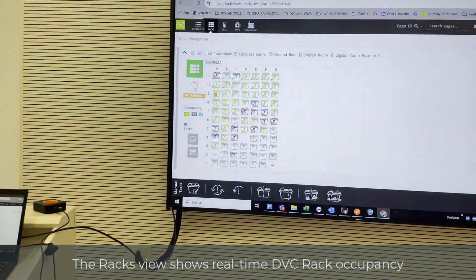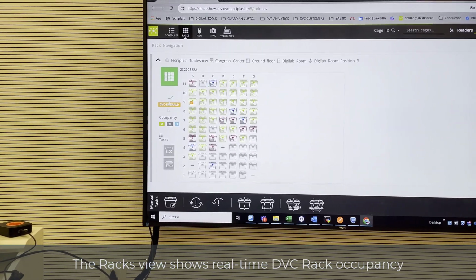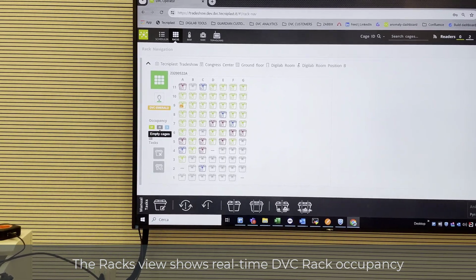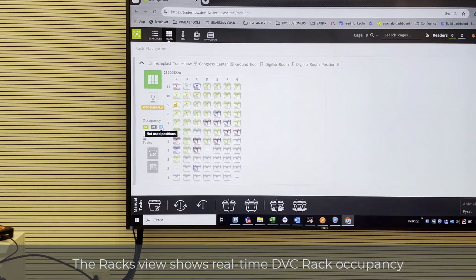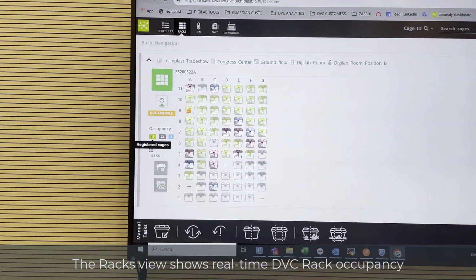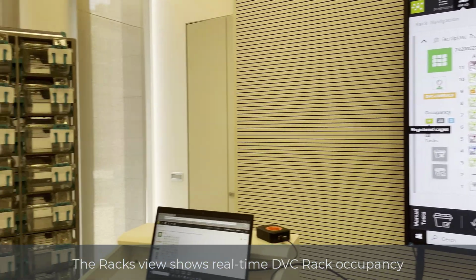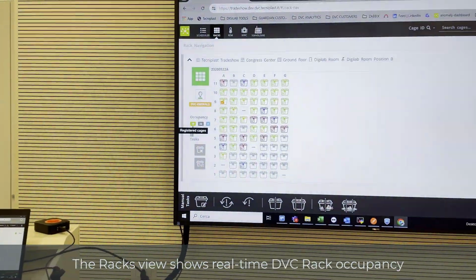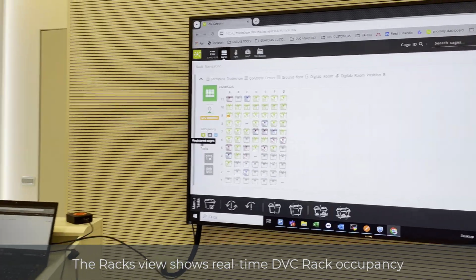There is also other useful information, such as how many registered cages, how many empty cages, how many positions are currently not filled with cages. When a cage is removed, automatically it disappears from the rack.